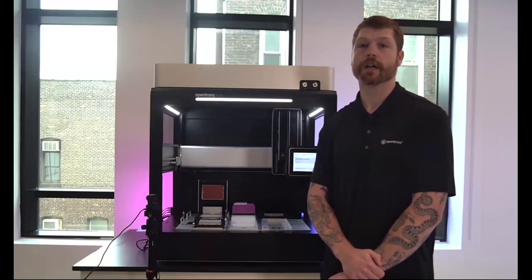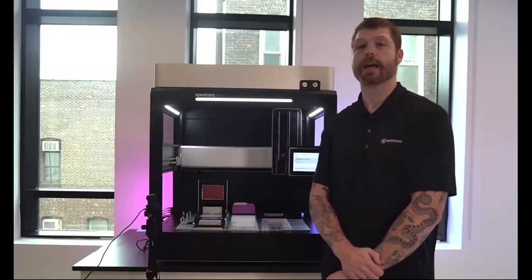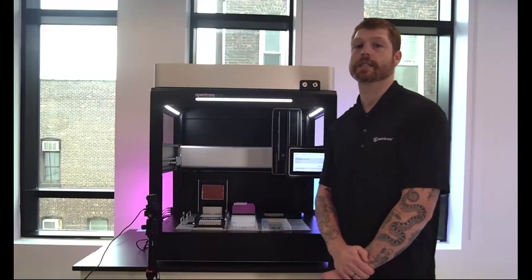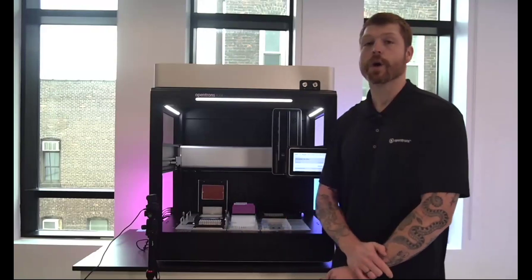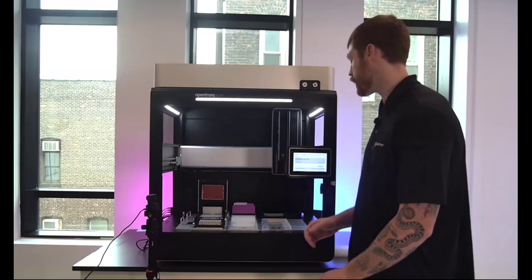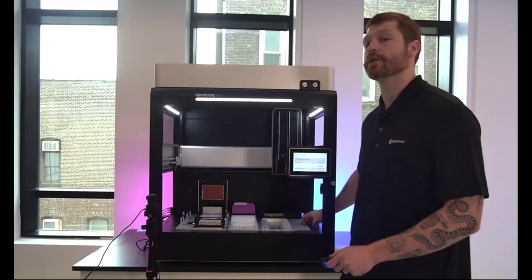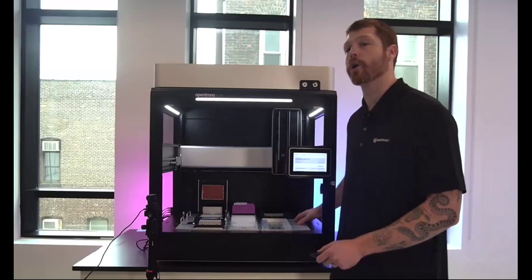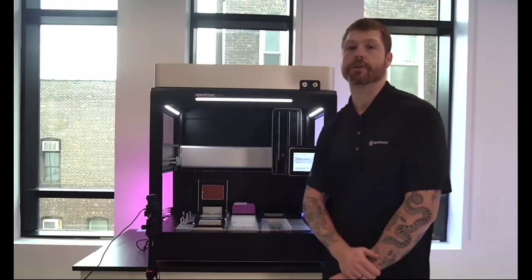The gripper is compatible with SBS format labware and also the tip racks to move them around. It has the ability to access the 12 standard deck slots, as well as 4 additional expansion slots, which can go on the right-hand side of the instrument. Those are only gripper accessible and can be used for housing things such as extra tips or stacked labware to be brought onto the deck at a later time during the protocol.